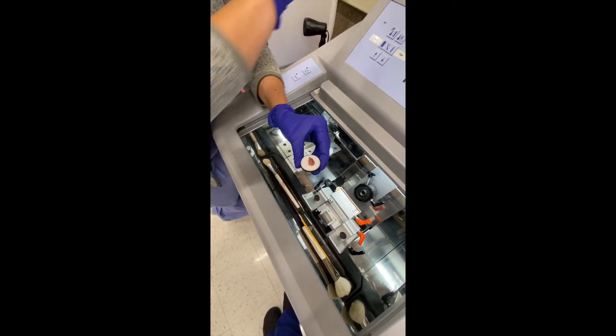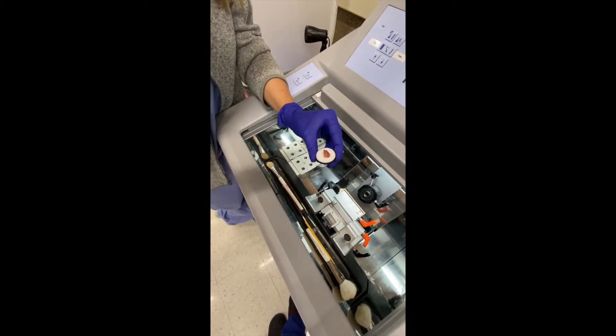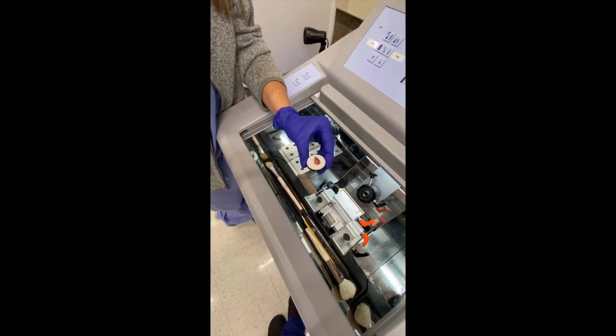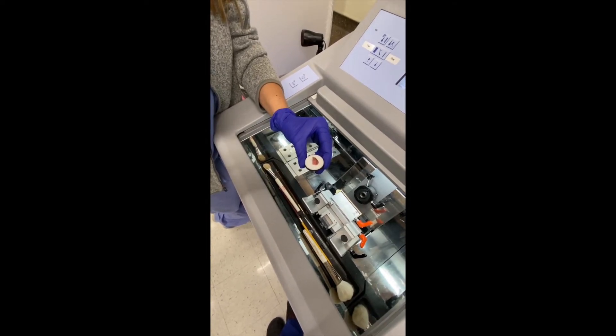Just like in embedding for histology, you need to make sure that you place the specimen in the center of the chuck so that there is ample room for OCT media to freeze around it.